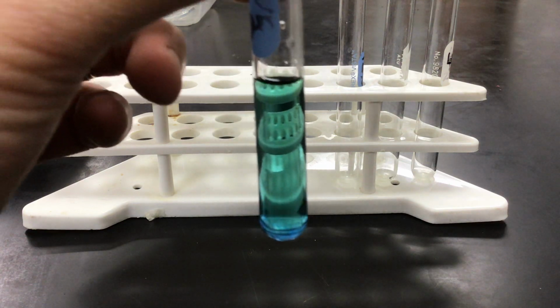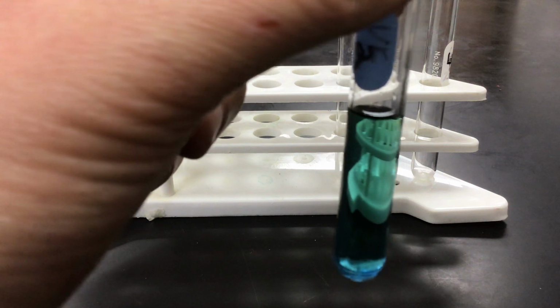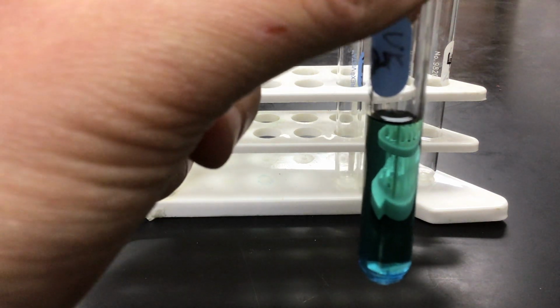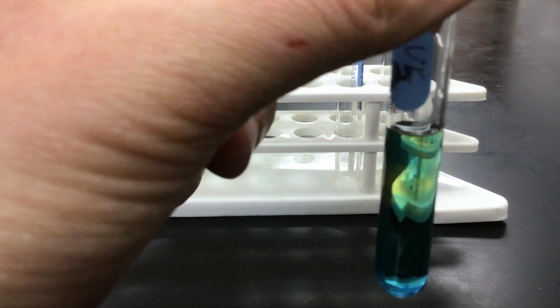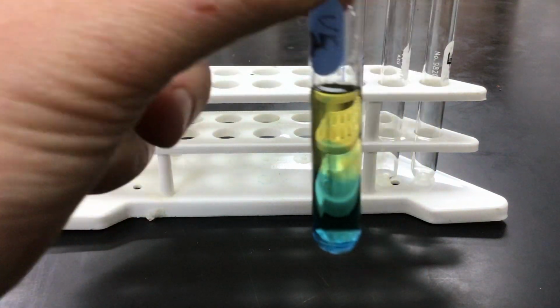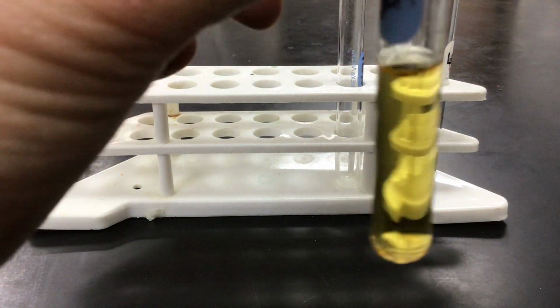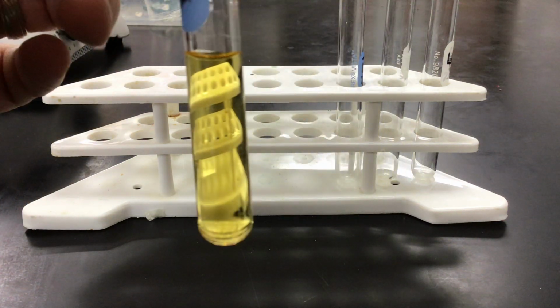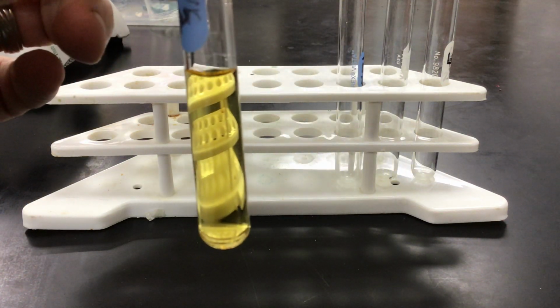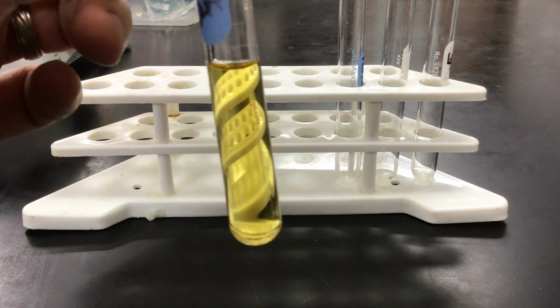I am now going to, in part 1, stress this system by adding hydrochloric acid. So I'm going to go ahead and add 5 drops of hydrochloric acid to it. And I'm going to stir it to evenly mix it. And there you can see there is a pronounced color change, and that's what you want to put down in your data table as to what happens when you add the 5 drops of HCl.